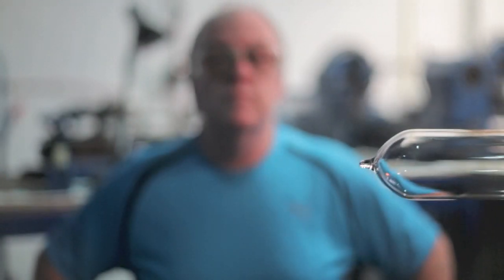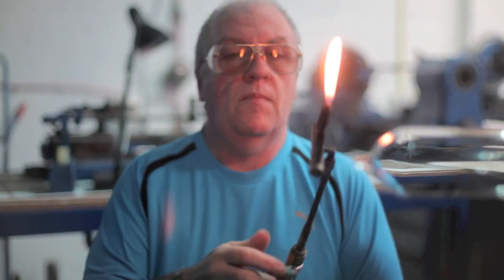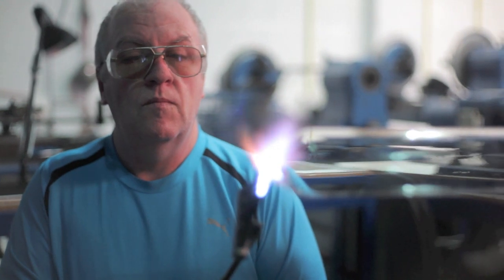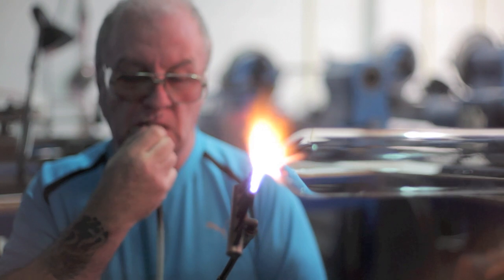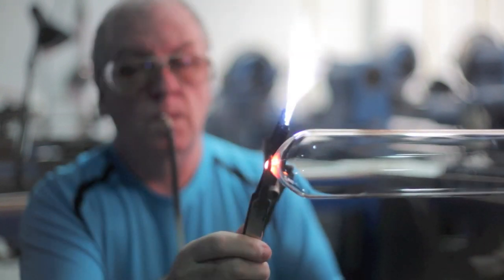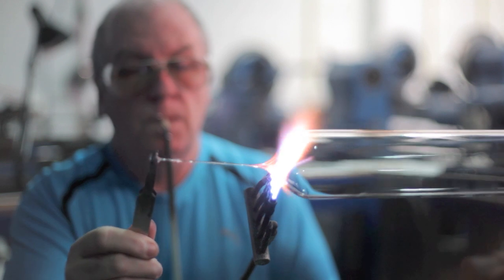I have got like a half tube in there, setting the lathe already, ready to be made into some beakers. So we start pulling off the waste to start with. The tube in my mouth there is just so that I can blow down the actual beaker tube, to pull all the waste off.